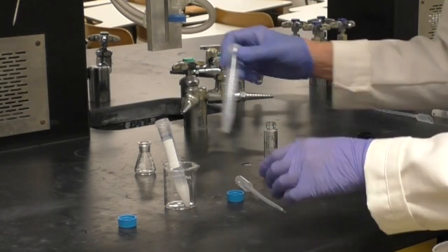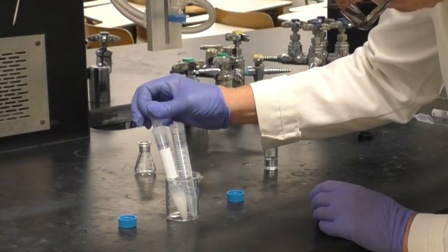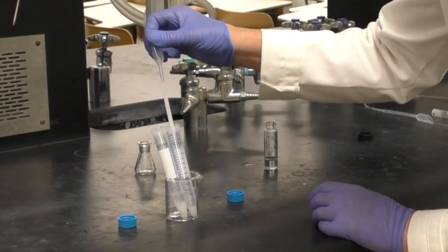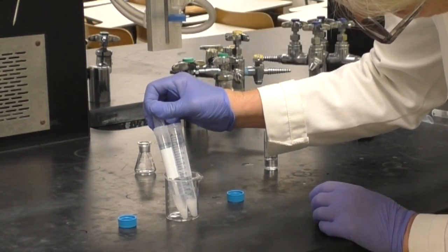Transfer the organic layer, which is the bottom layer, to another clean 15 milliliter centrifuge tube.